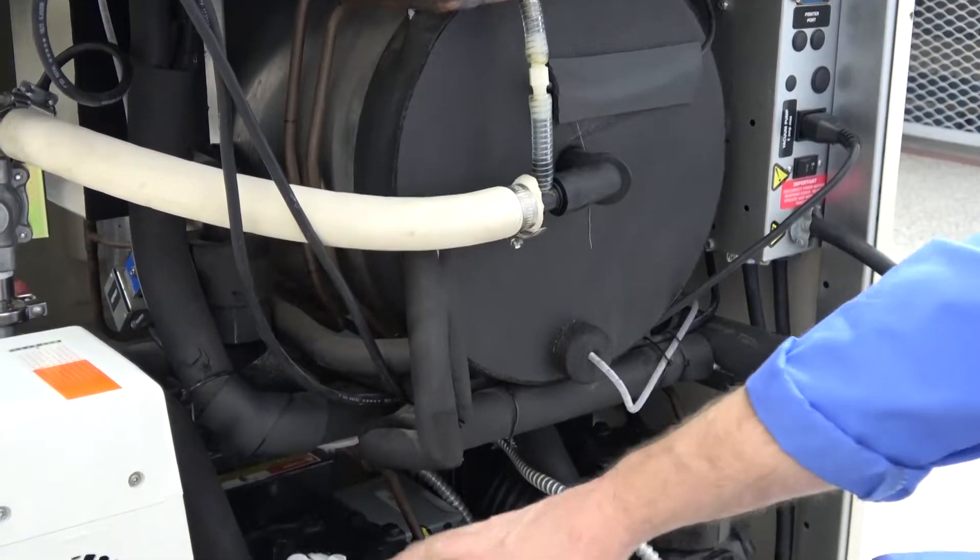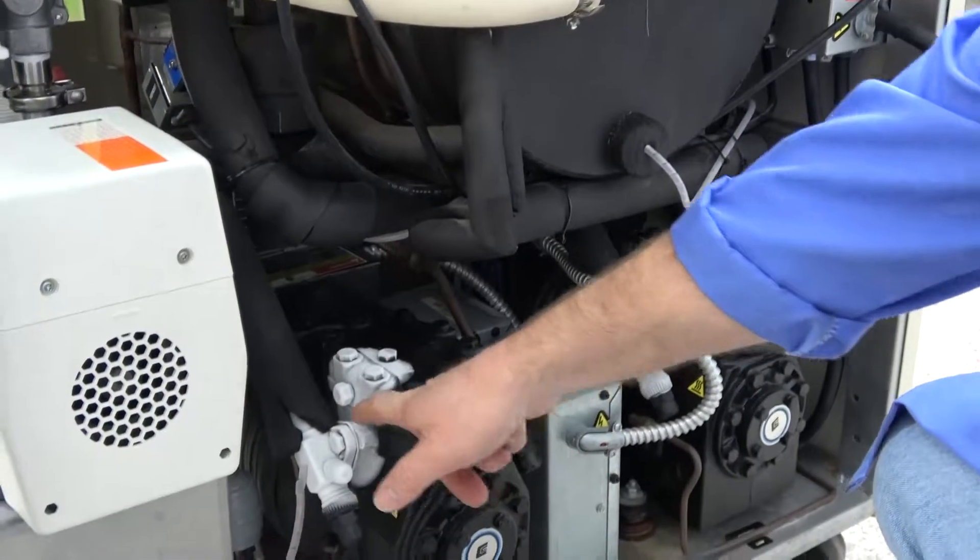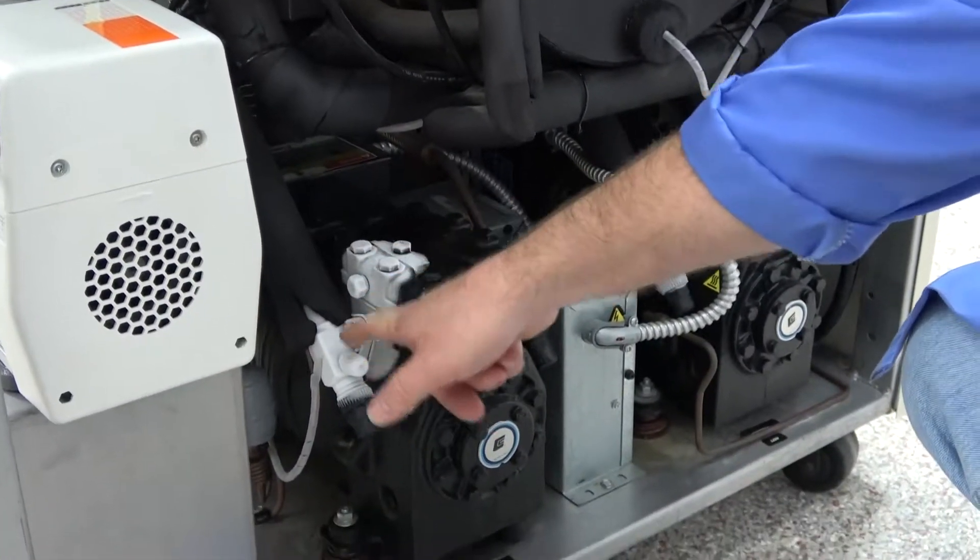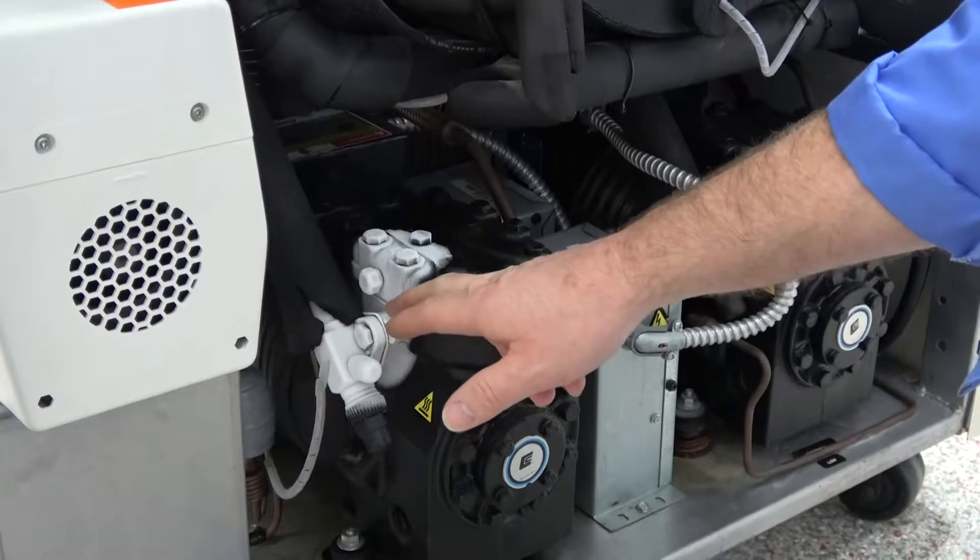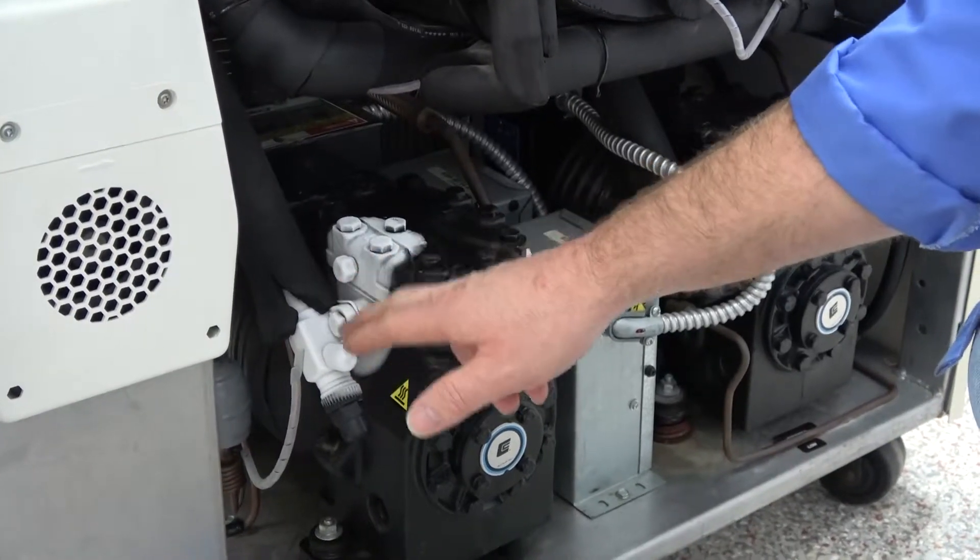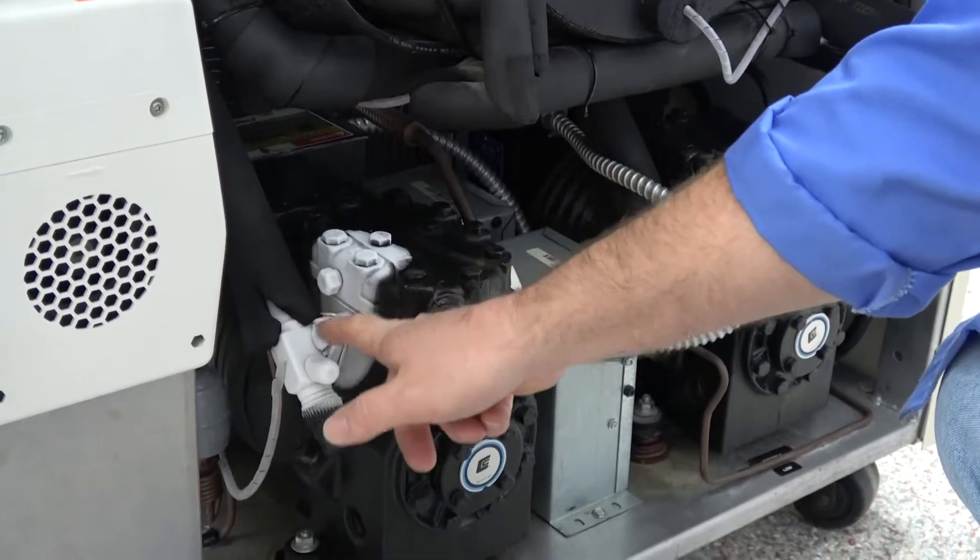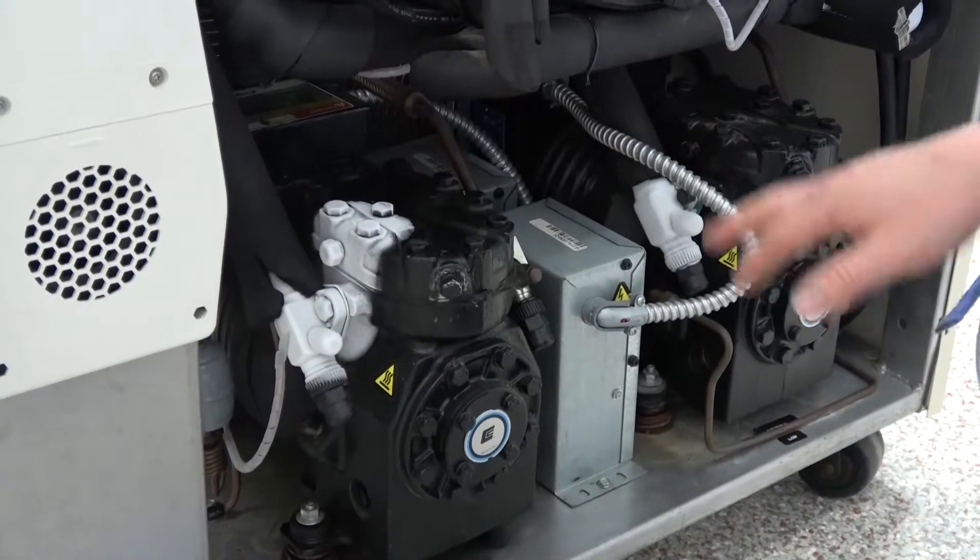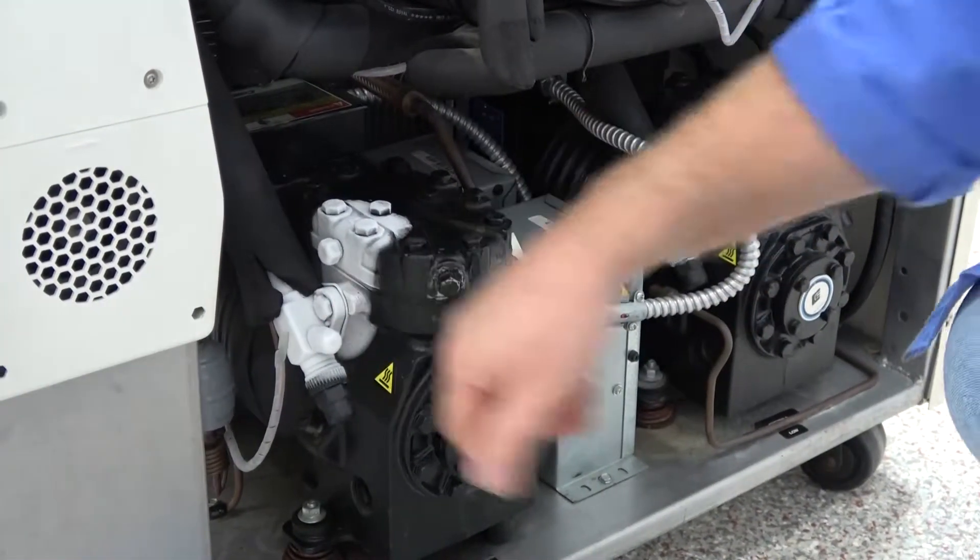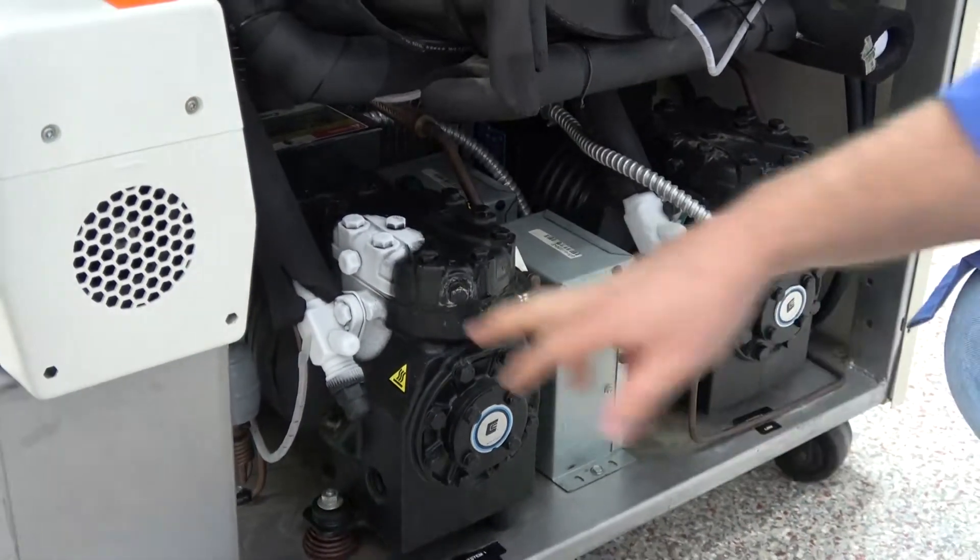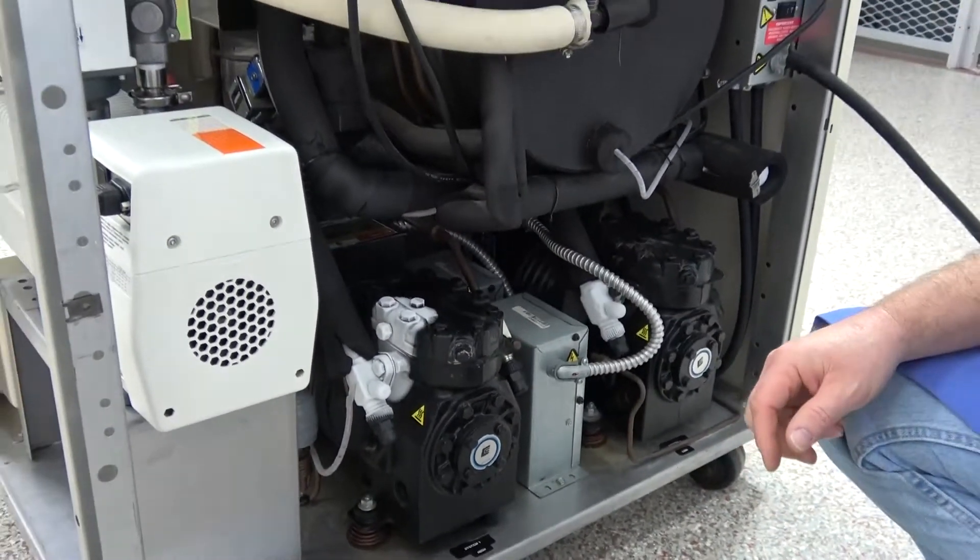If the frost here was gone, you would notice that there's no rust in these areas. Normally with a lot of use, what happens because of the frost build up, the defrosting, you get rust in this area. But there's absolutely no rust going on on these two bolt-on ports here. So I just wanted to point that out.